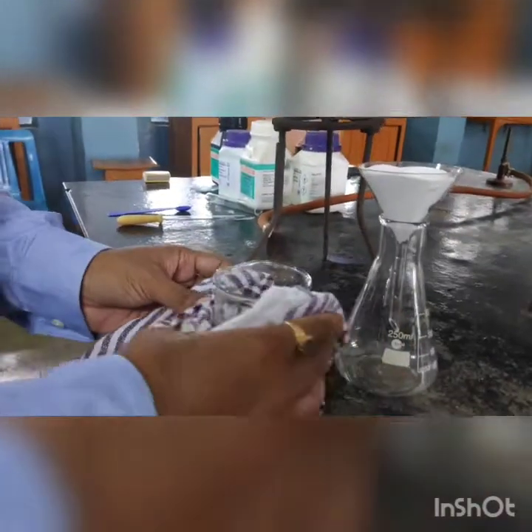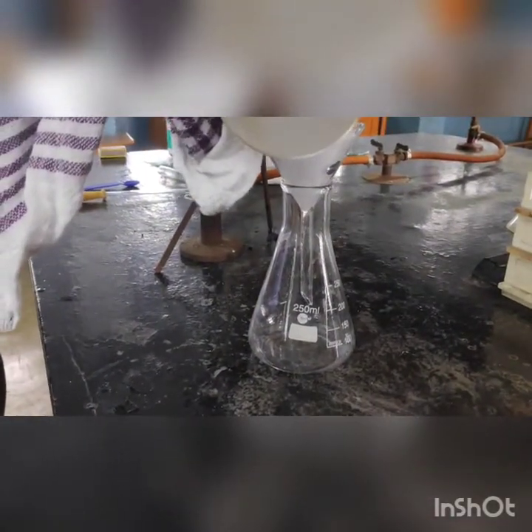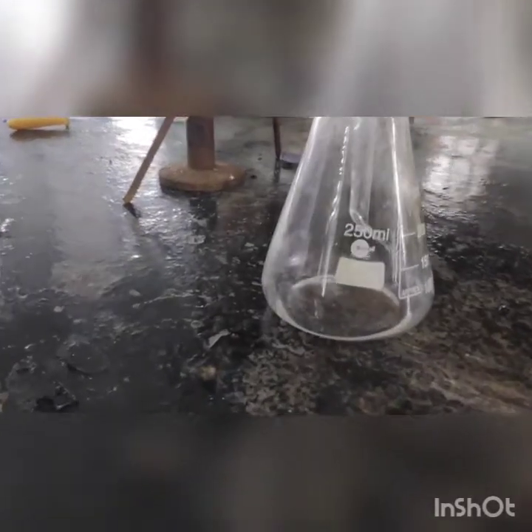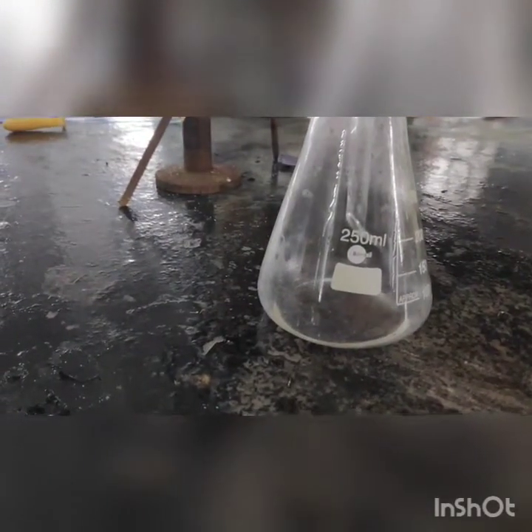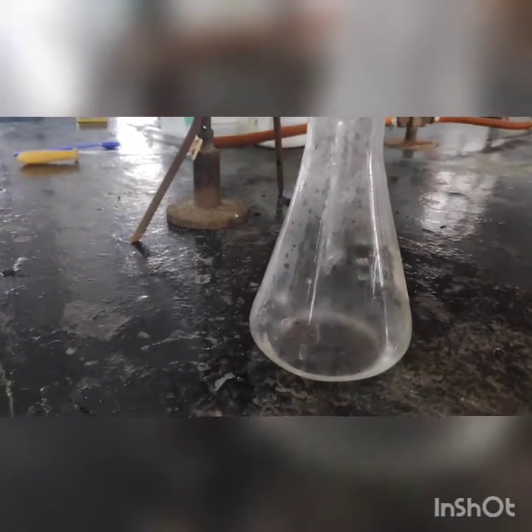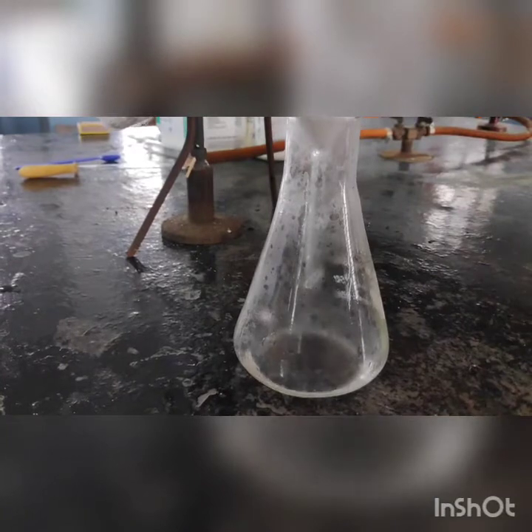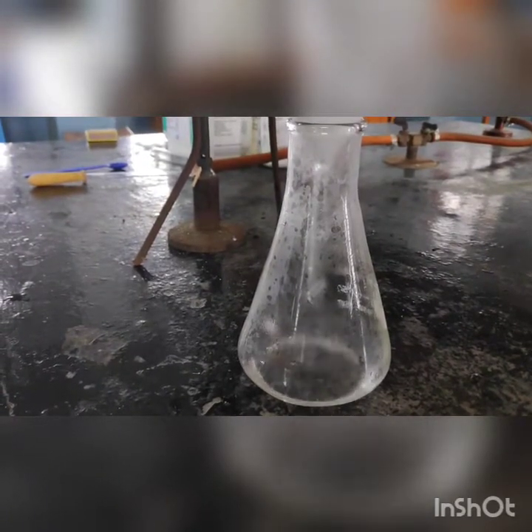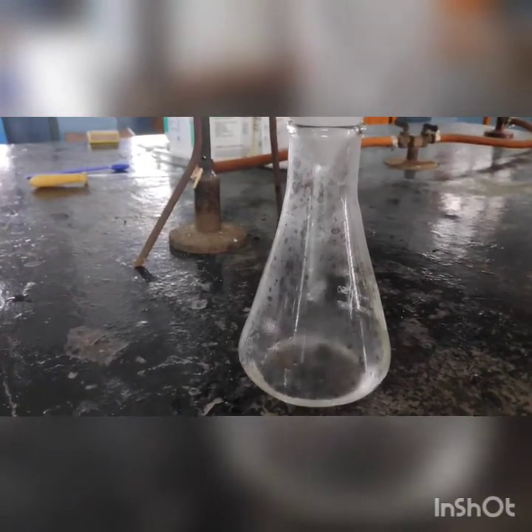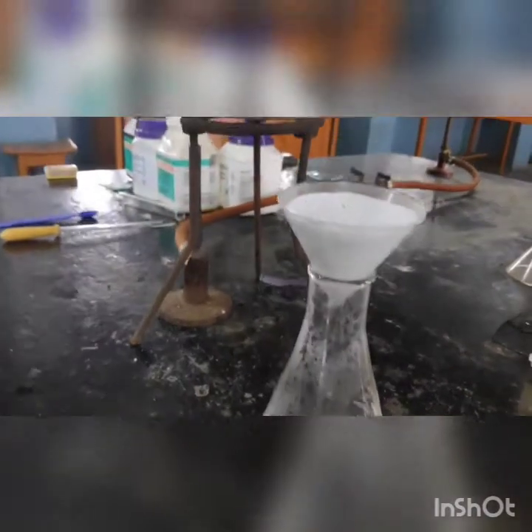The hot solution will now be filtered so that the filtrate and precipitate can be obtained separately. A clear solution is being obtained as the filtrate, containing the anion of the salt taken for analysis. On the filter paper, the precipitate of the carbonate of the cation will be formed.